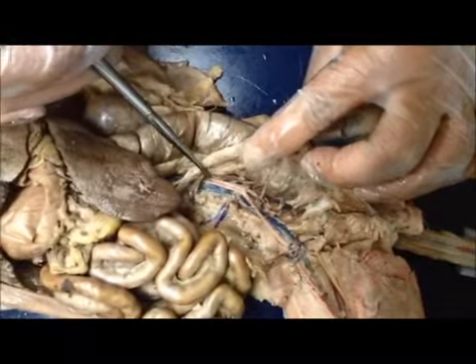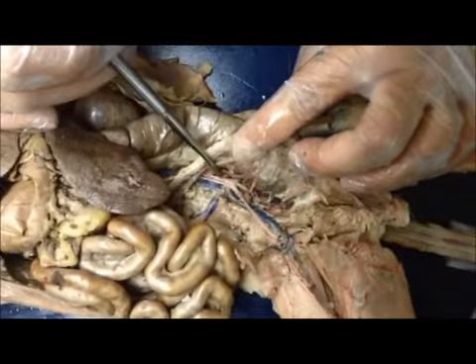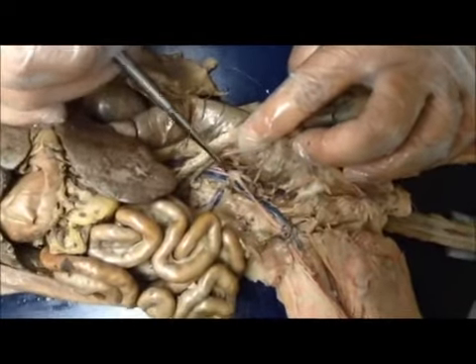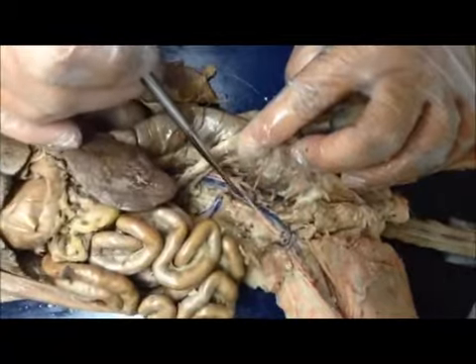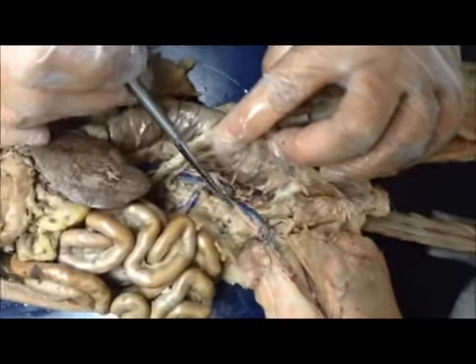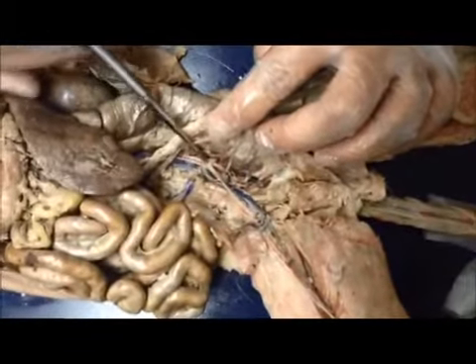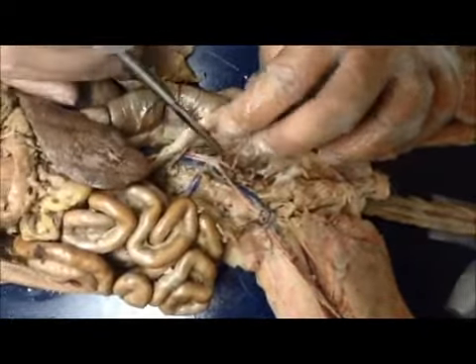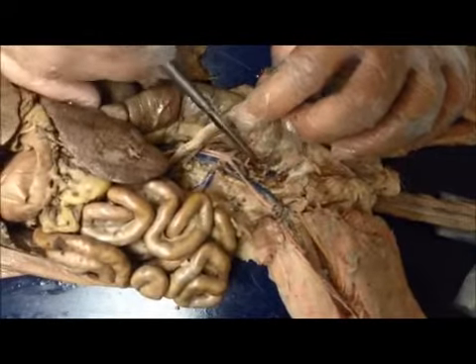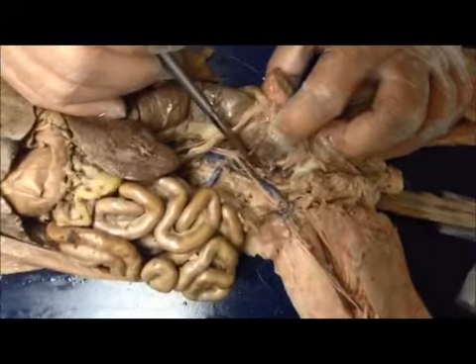In the arteries, we have coming down the abdominal aorta. Coming off of it just before the leg splits off, we have coming to the back the iliolumbar artery. Coming back down, going towards either leg, the first thing we come to is the external iliac artery, which turns into the femoral artery. Coming back up here, right after the break off for the external iliac, if you continue down, we have a split here. This is splitting to the internal iliac artery on both sides. Going deep within the tail, pointing right down there, it splits down into the caudal artery.